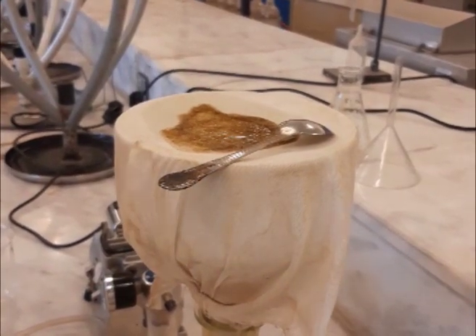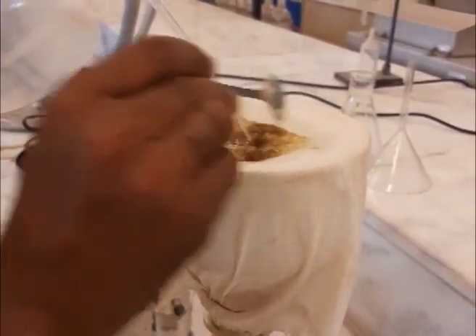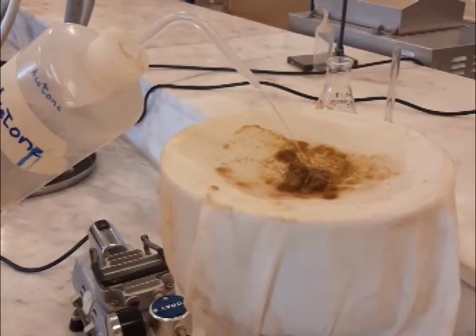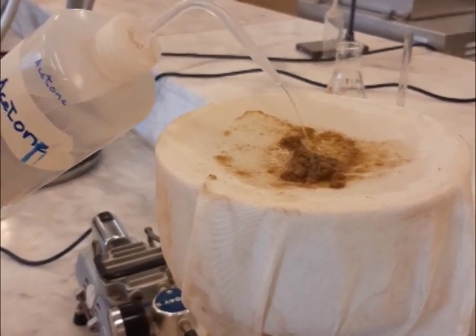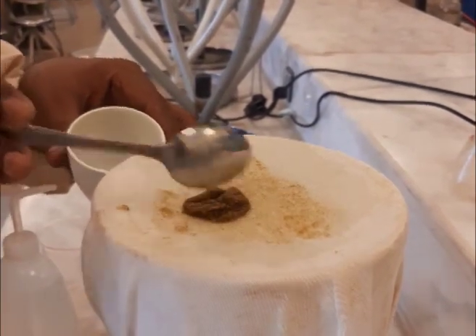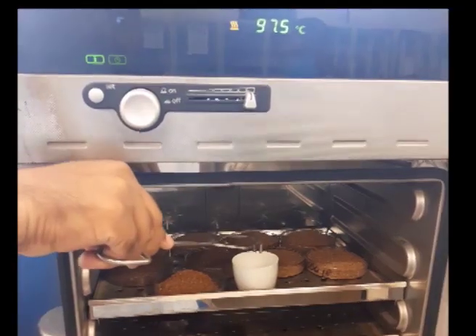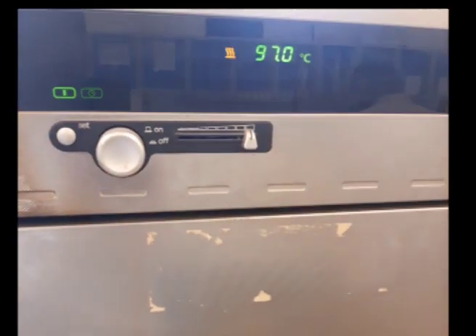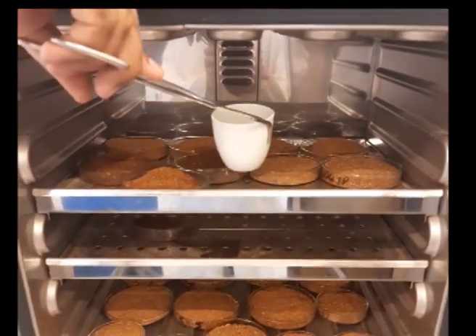After filtration, the residue left on the filter paper or muslin cloth should be washed with at least 2 to 3 portions of hot boiling water, followed by at least two washings with acetone. Then collect all the material into a pre-weighed, dried crucible. Let it dry in the oven at 103 degrees Celsius until constant weight is attained.